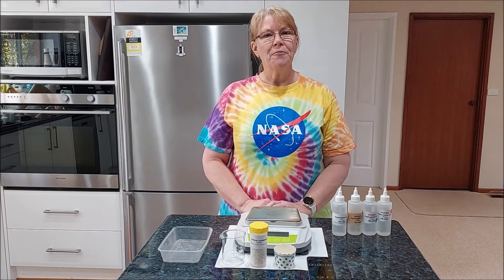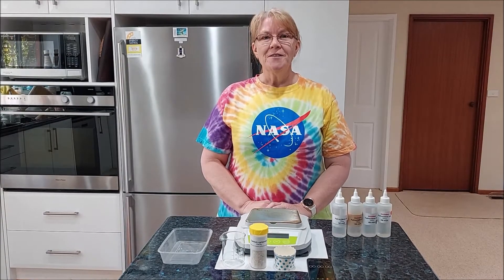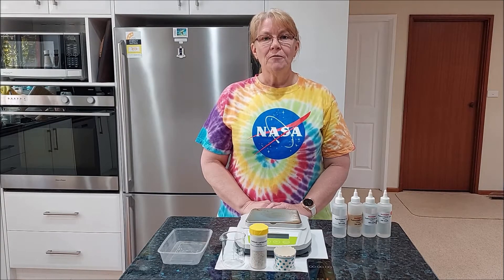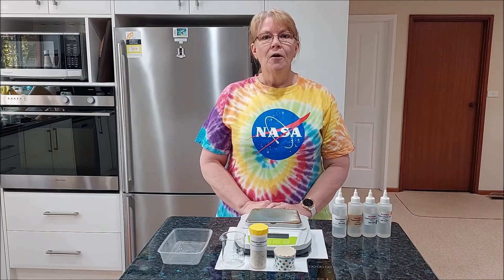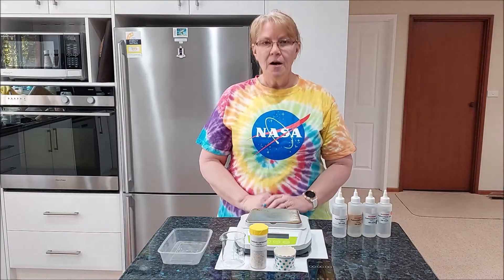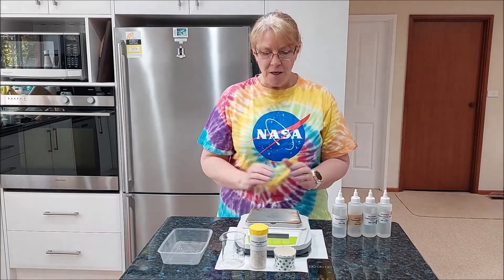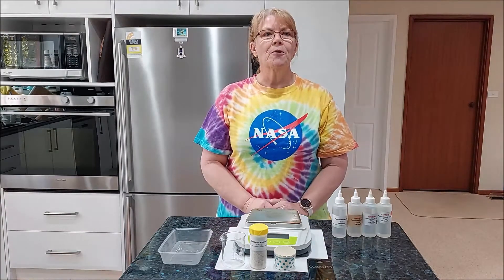Hi, Mrs V here and we are in the Lockdown Lab once again. Today we are going to look at an experiment that determines the effect of the concentration of hydrochloric acid on its rate of reaction with marble chips. For this I'm going to need some marble chips, various concentrations of hydrochloric acid, an electronic balance and a stopwatch.